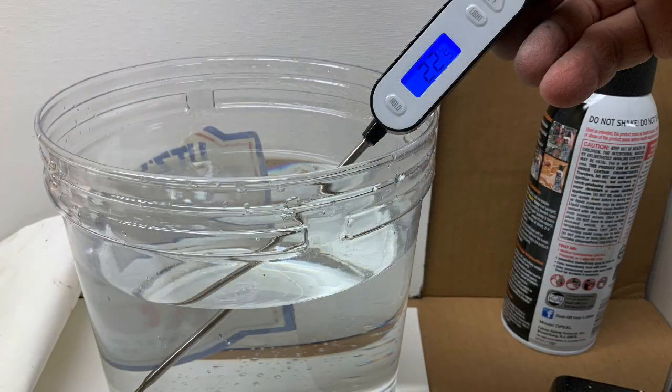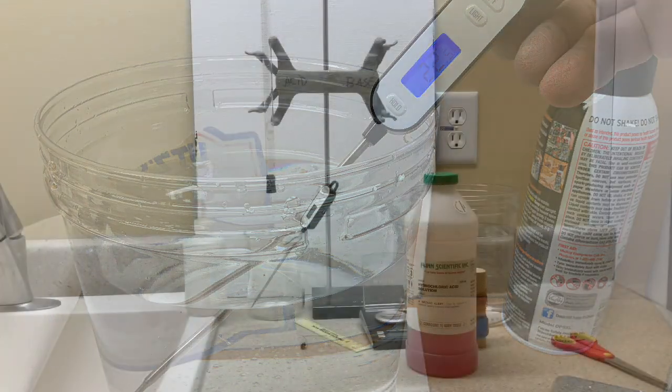Now be sure and take the temperature of the water. We'll assume the air is the same temperature.